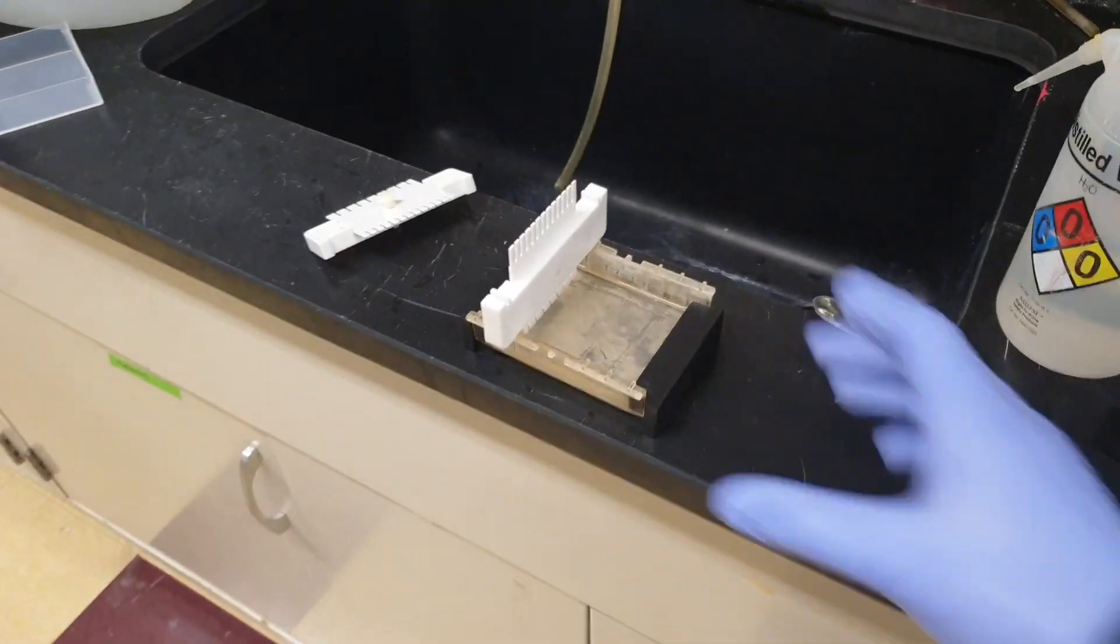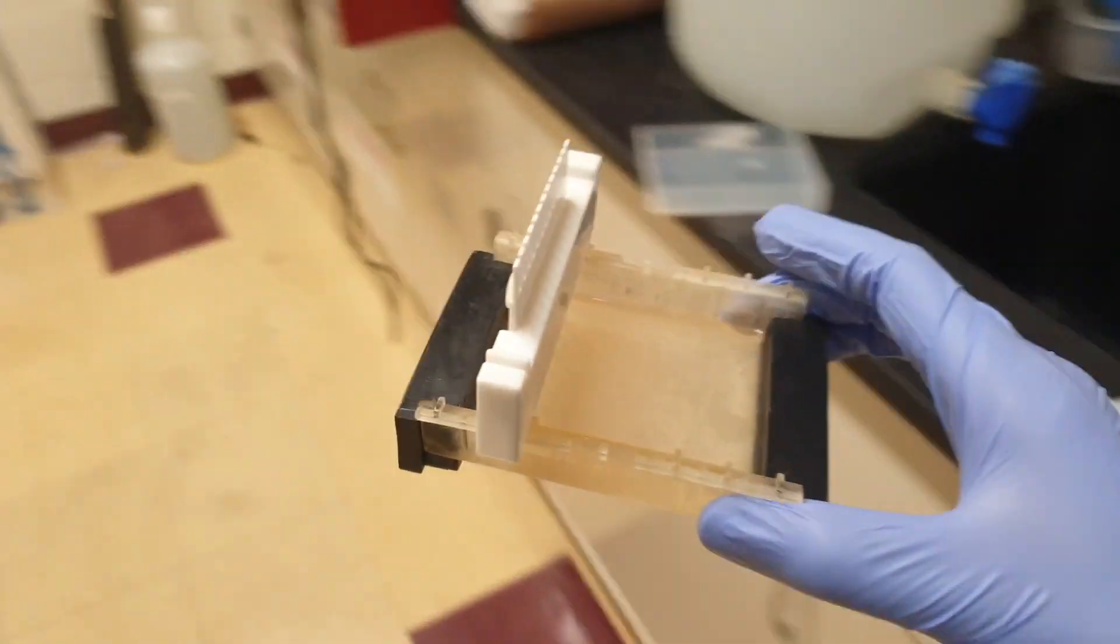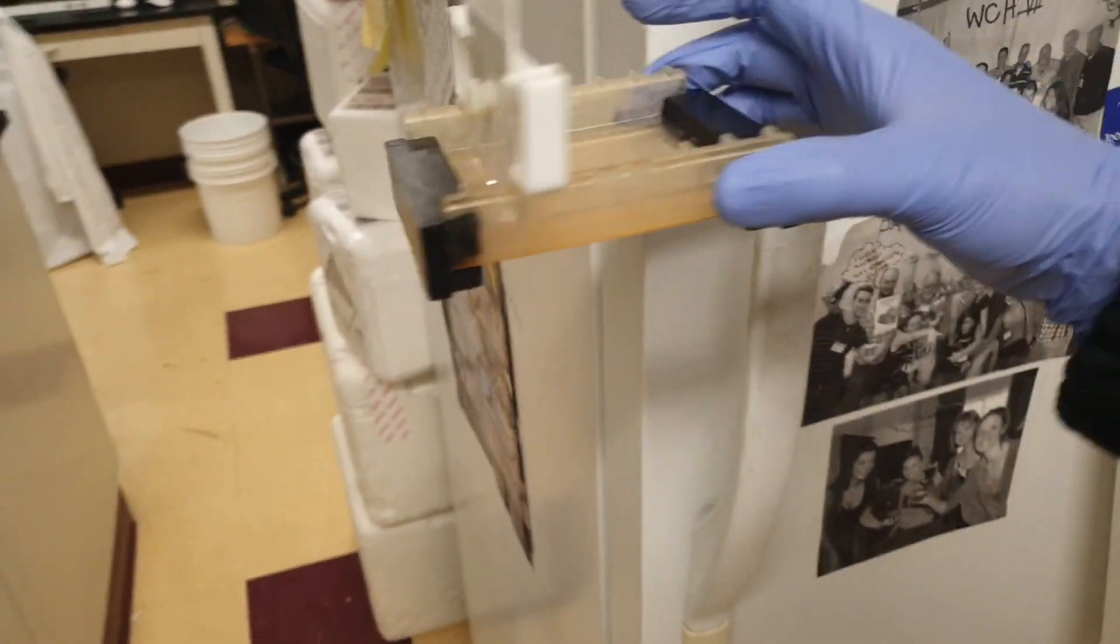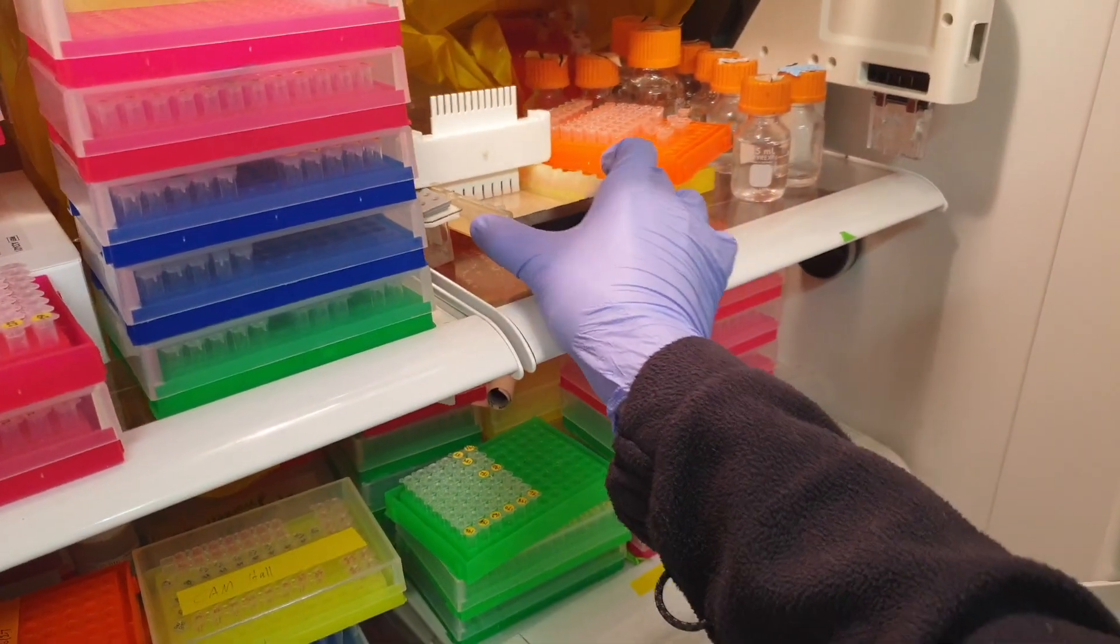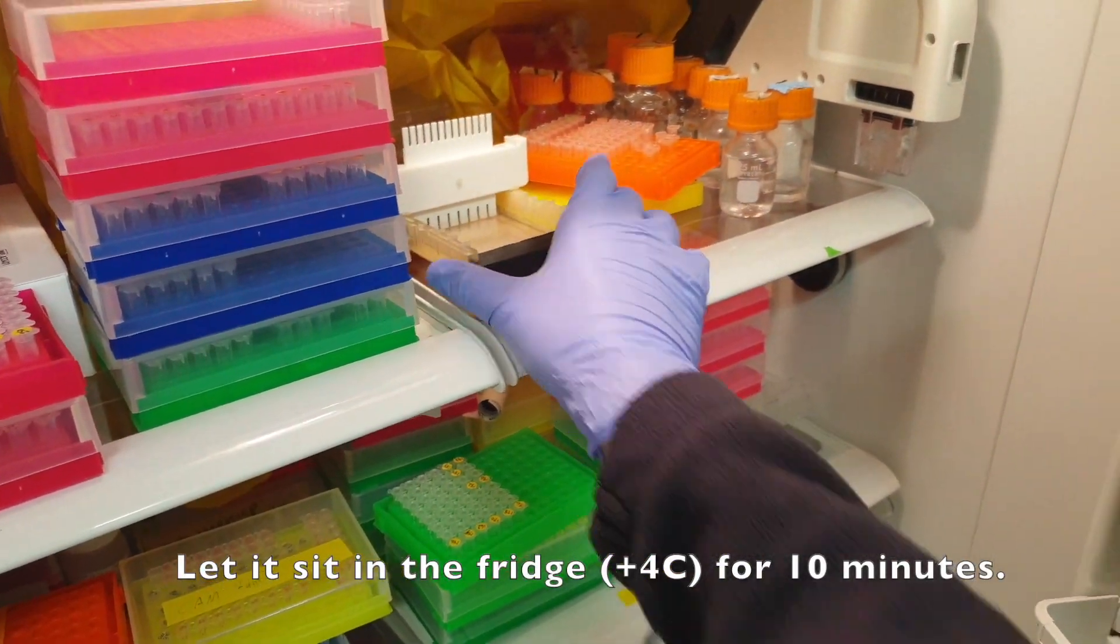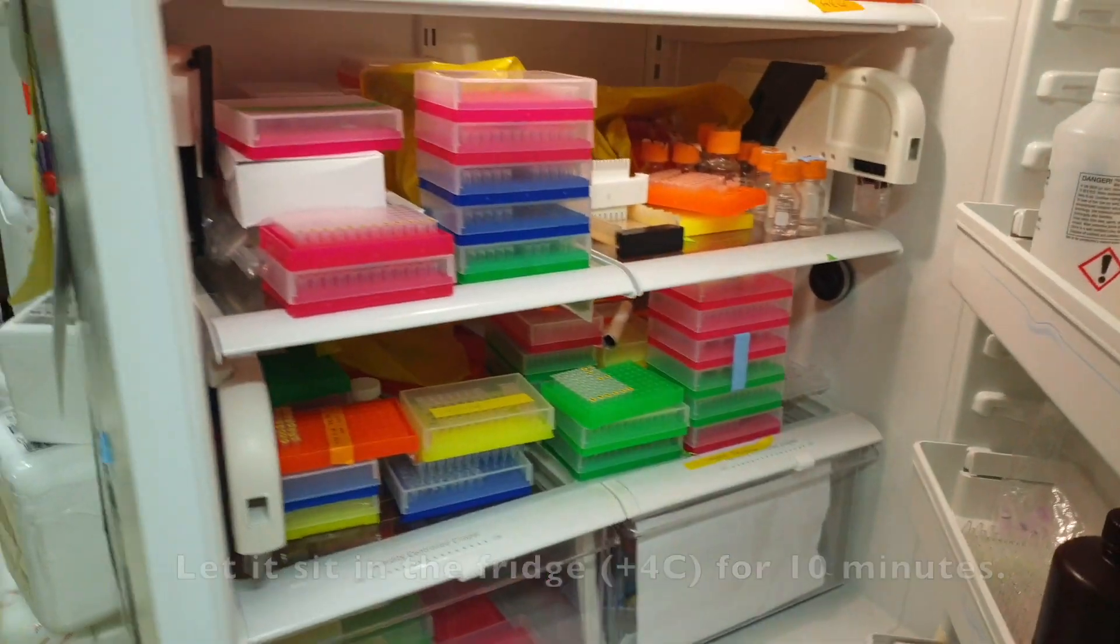Alright, so it's been 20 minutes, it's not jiggly anymore, but we're going to take it to the fridge so it hardens even more. We'll come back in 10 minutes.